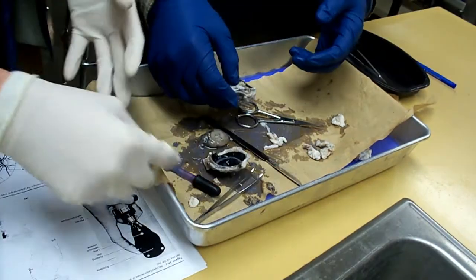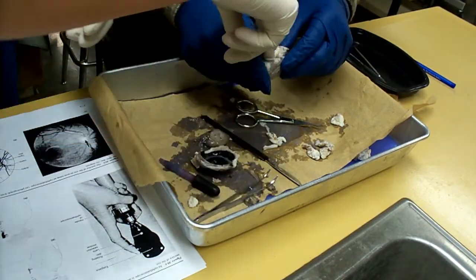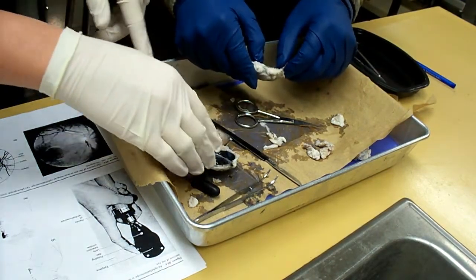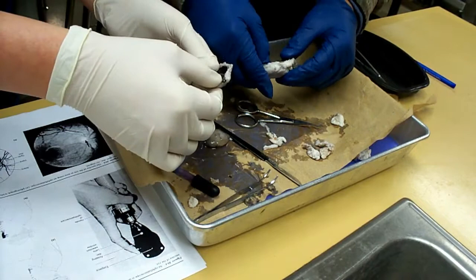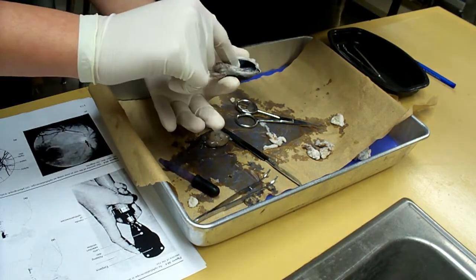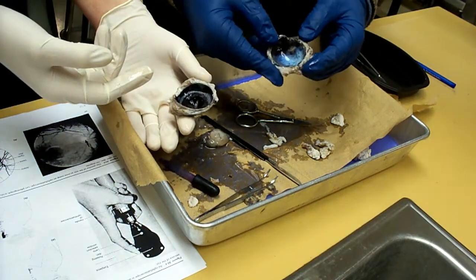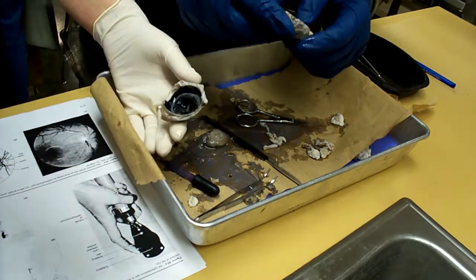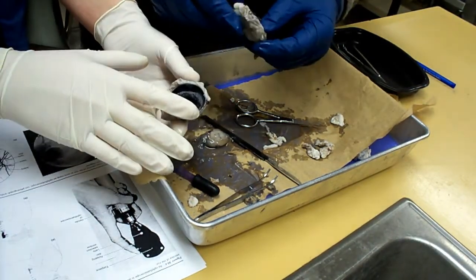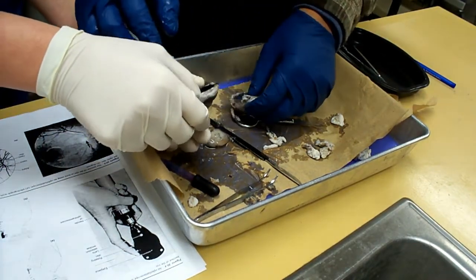Now what do we do? We identify it. That is the pupil. Where's the optic nerve? That's the thing we just talked about in class. It's a shiny thing and it's in the dark. This is the iris all around. I think I found the optic nerve, it's right here. Cornea. Did you see that white thing right there? That's the cornea, I think.